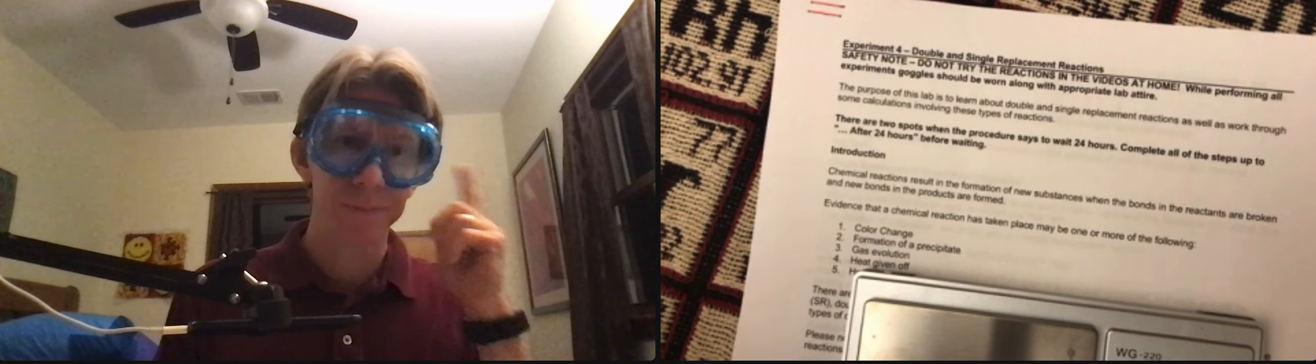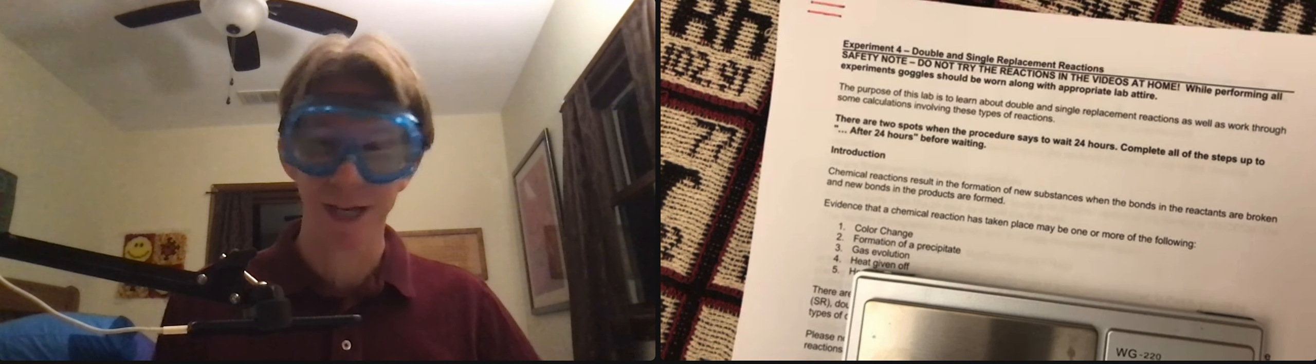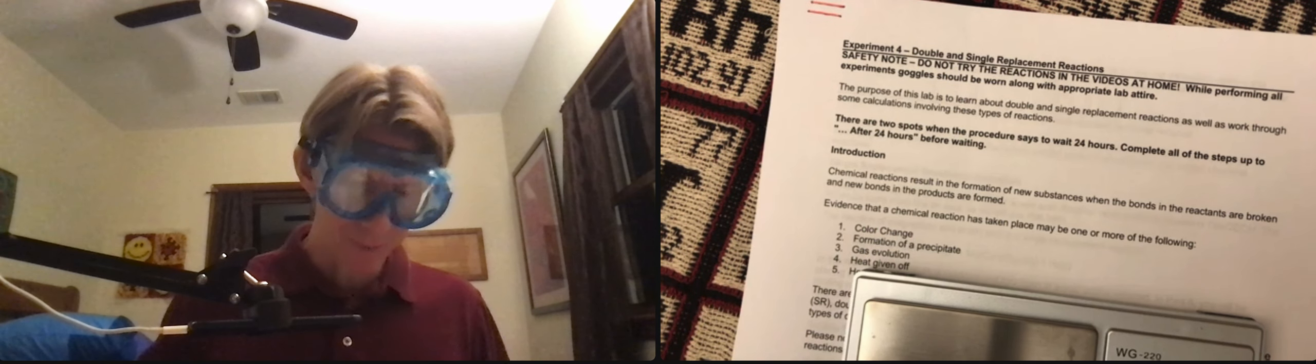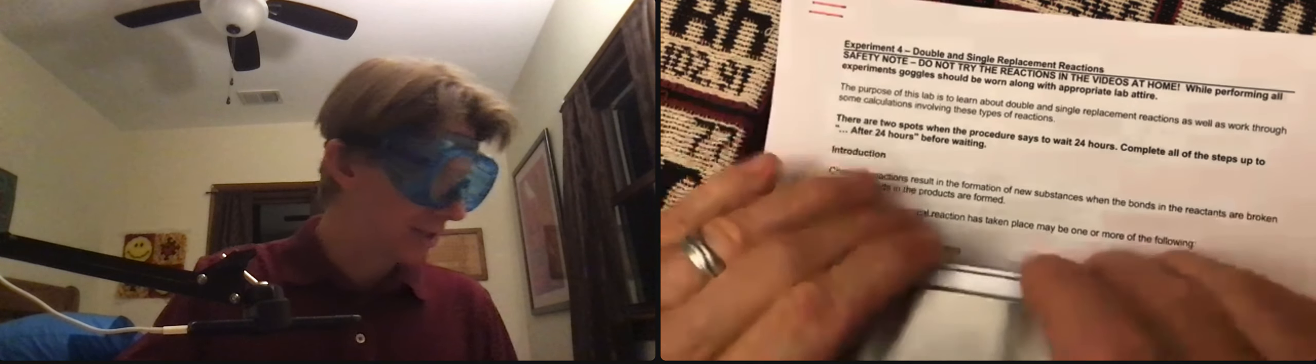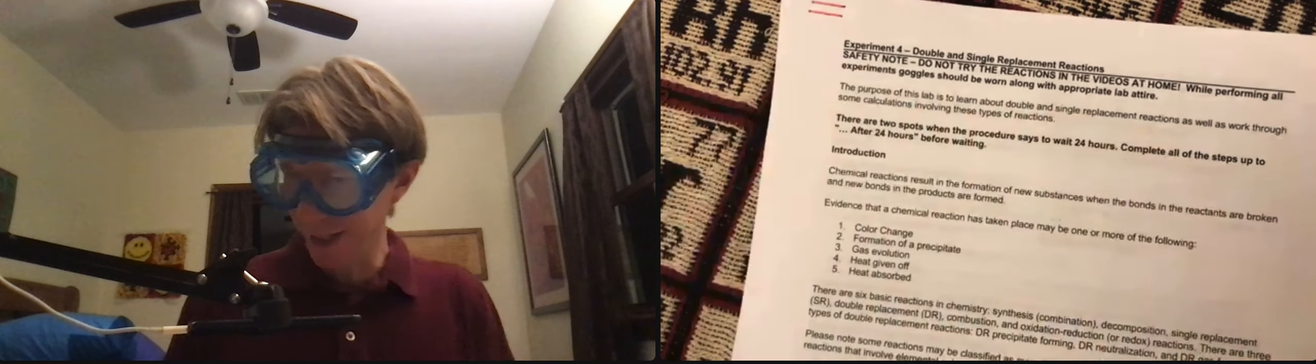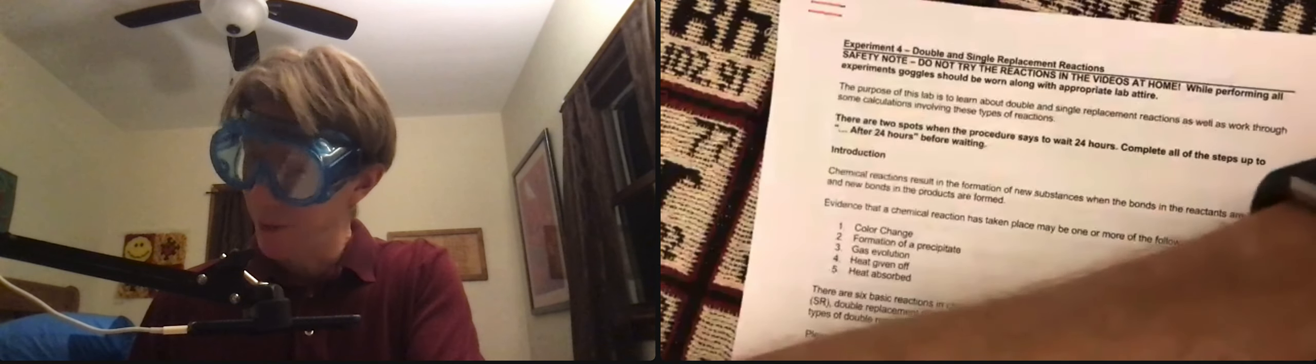Welcome to experiment number four. You can see I've got my goggles on even though I'm only doing the introduction to the lab so far. I've got my lab handout and my scale already here, but I'm going to move that over to the side for now. And I've got my report sheet over here with my name on it already.